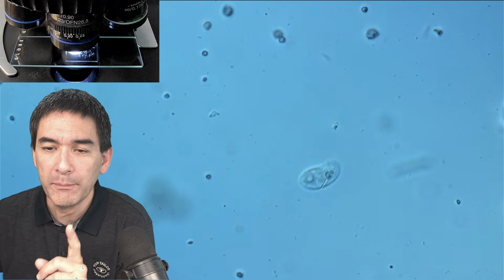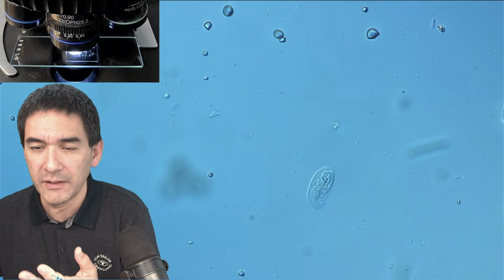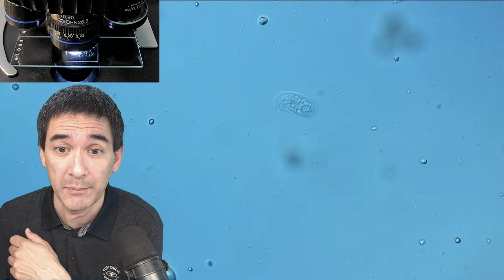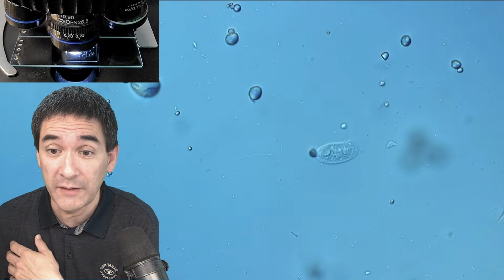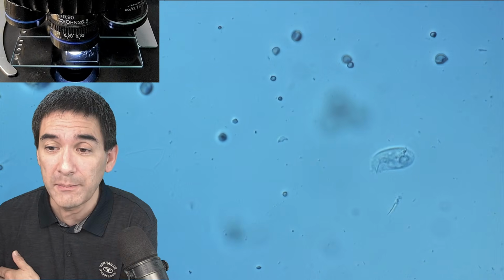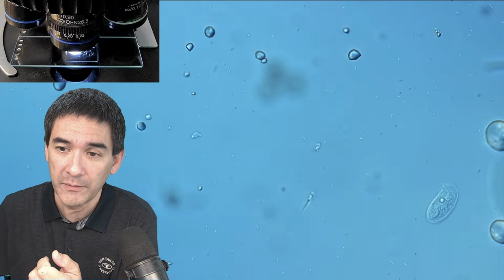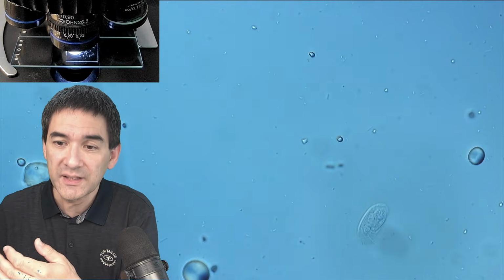Last comment, important. In case you're a little bit thinking, well, actually, these are not paramecia, it's something else, I want to see those large paramecia. It really depends on what is present in the water sample. With the same starch, with the same wheat grain method, I've already found completely different organisms. It really depends what's present in the water sample. And over a couple of days, there's a progression. This means one type of organism starts to grow and then it disappears. It's succeeded by another one.